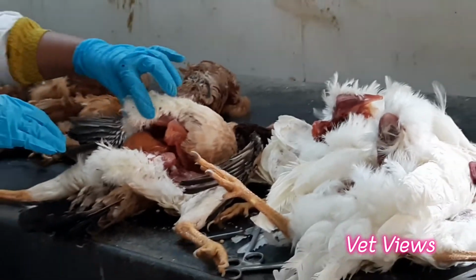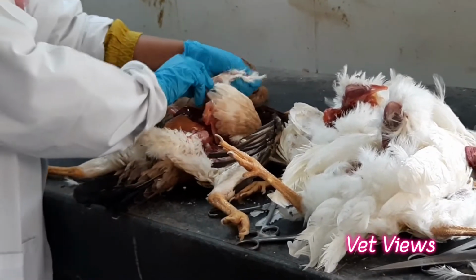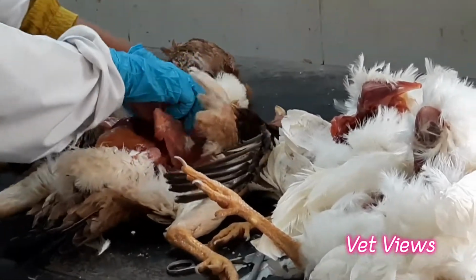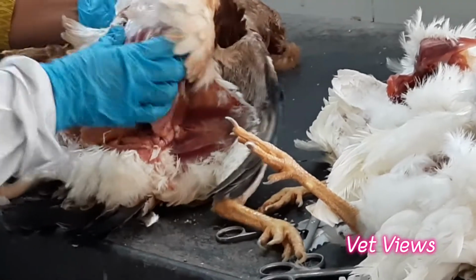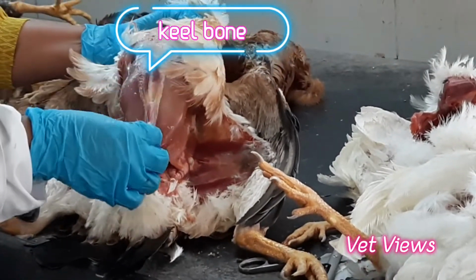First, this is the keel bone end. Just remove the skin over this and observe the breast muscle portion. This is a well-built body. The muscle should completely fill the keel bone. This is the keel bone, and it should be straight.